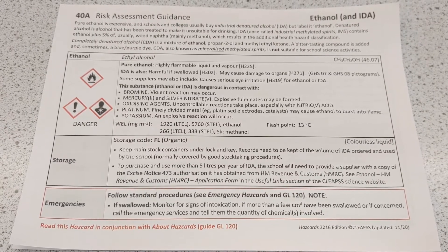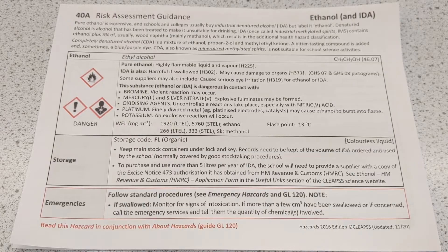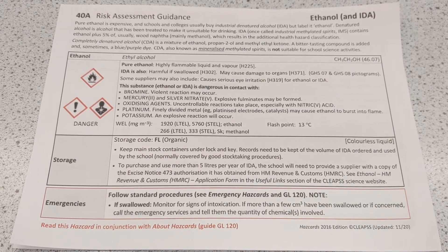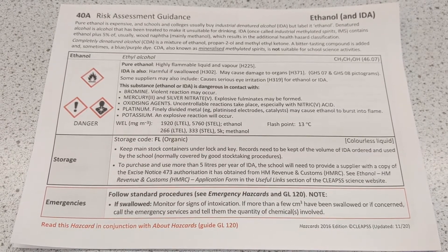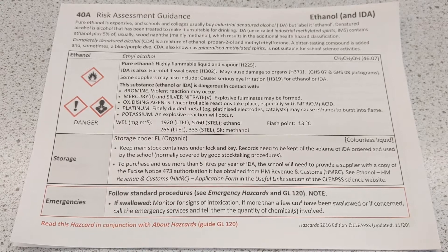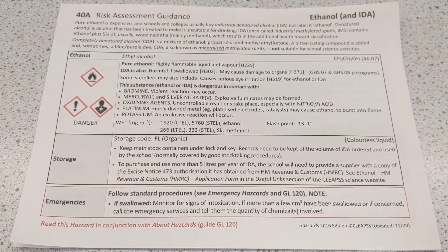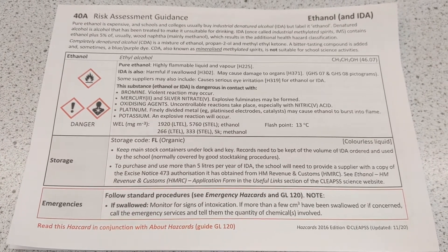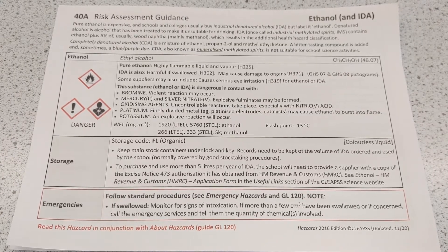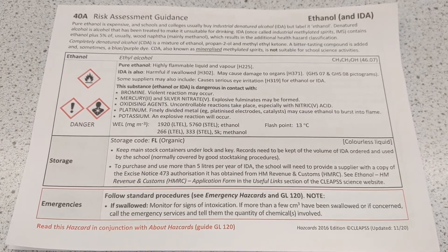If we look at the hazard symbols — the little red diamonds with the pictures inside — we can see some of the hazards associated with ethanol. It's flammable, so there's a risk of fire, and it's harmful and can cause organ damage.